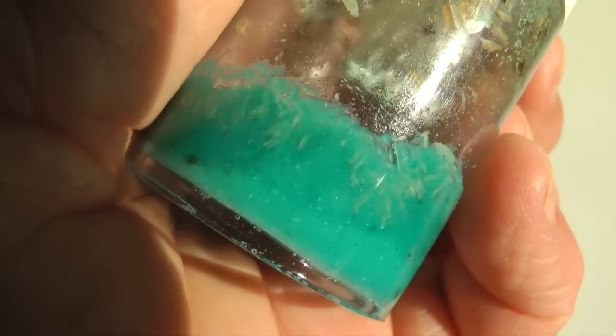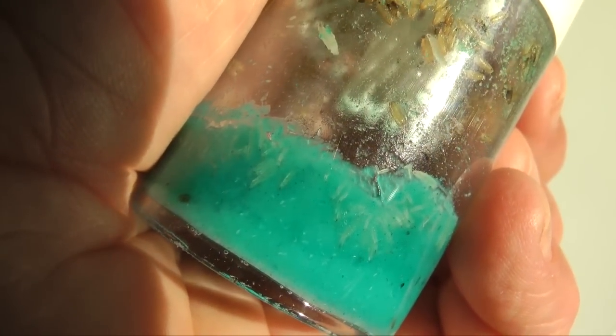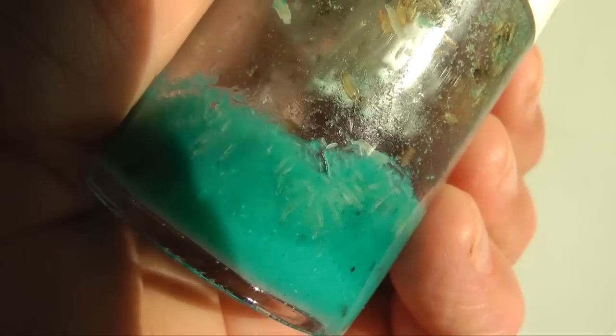You can clearly see the stages in this vial. Various sized larvae are visible on the walls of the container. Pupae are attached to the mesh.